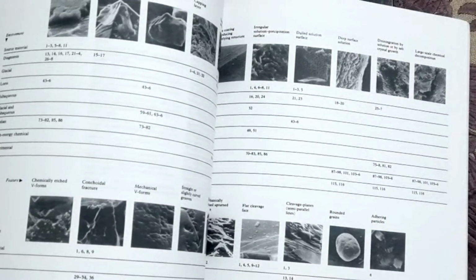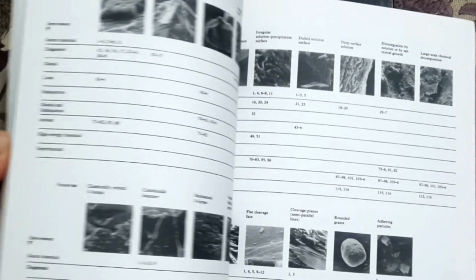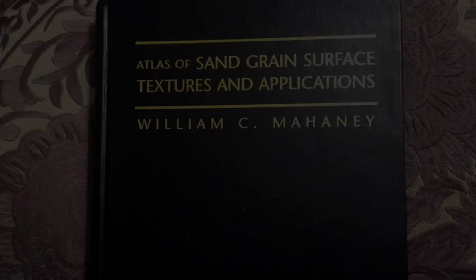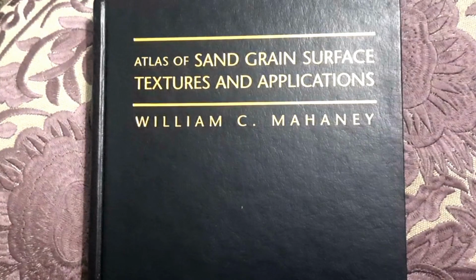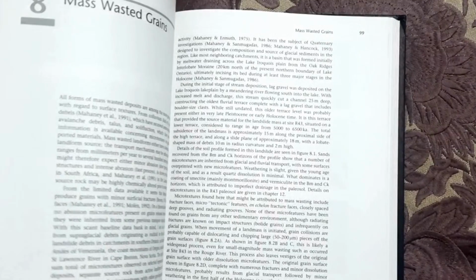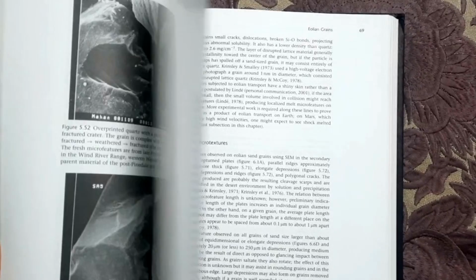It will create different features on the surface of those grains, and they'll all be recorded there, and you could see them under not a normal microscope but a scanning electron microscope. And people created a whole field of research, even atlases of the scanning electron microscopy surface features of the sand particles. I dove into that and spent several years preparing my samples, which takes a lot of time, and looking at them under this SEM.